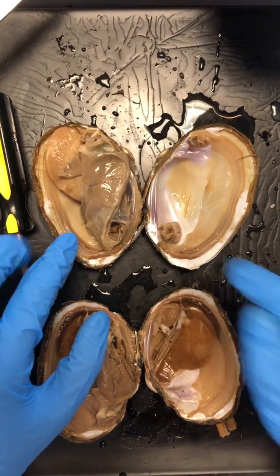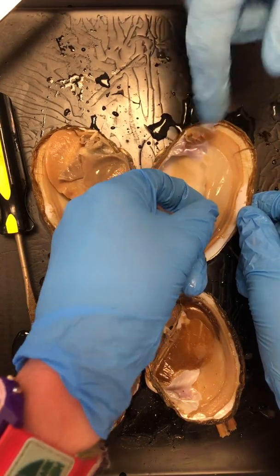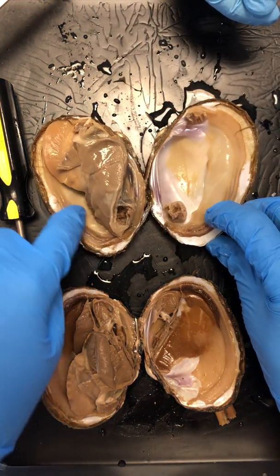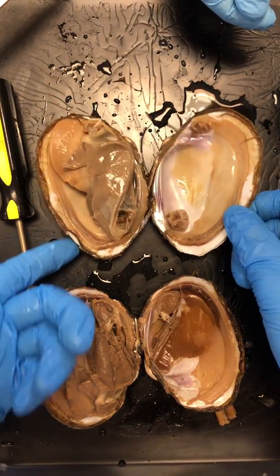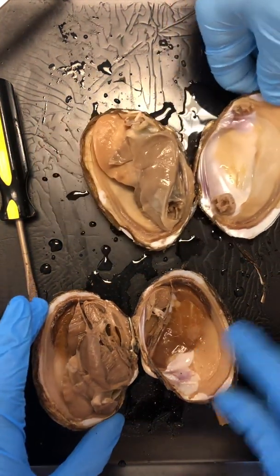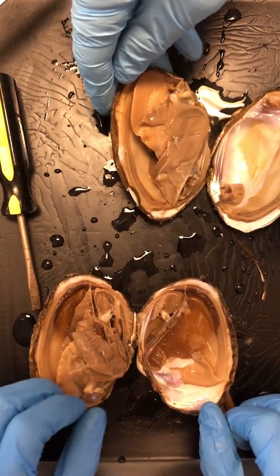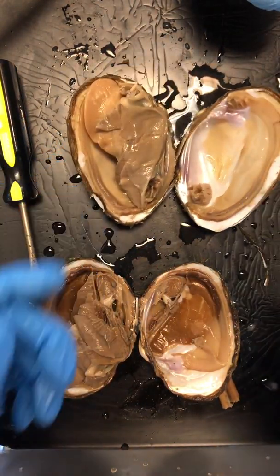On top of our shell, we have this soft tissue. It's kind of slimy. It's really, really thin. You can feel it. It's really, really smooth. This is your mantle. So this mantle lines the inside of your shell. It's actually on both sides. You can see it over here as well. Its job is basically to protect your visceral mass, the soft, squishy junk, from your nice hard shell. So this mantle is a protection layer for your inside. Here's that mantle, and then that mantle again underneath. Mantle on the other side too. Yes, so double mantle, double shell, which is why this guy is a bivalve.